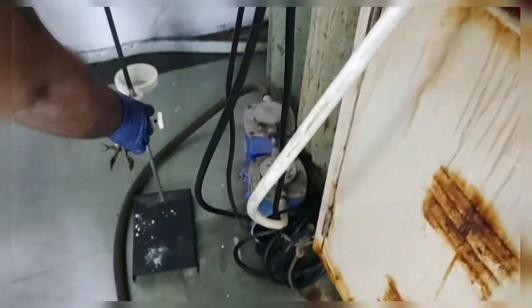As you can see, this is a vacuum pump which has been connected to the sintered funnel through this pipe.